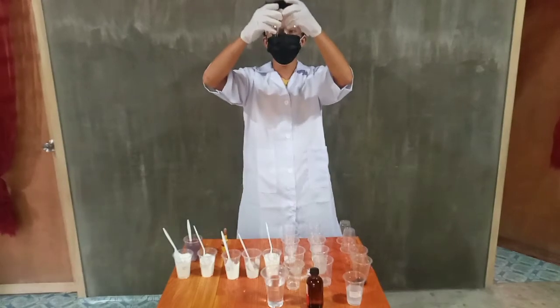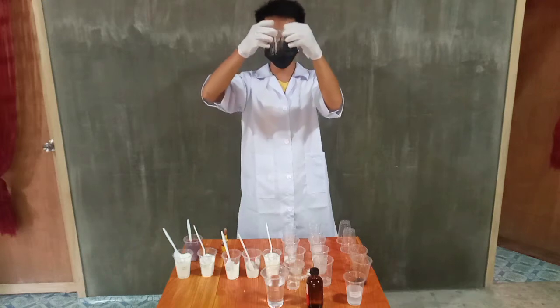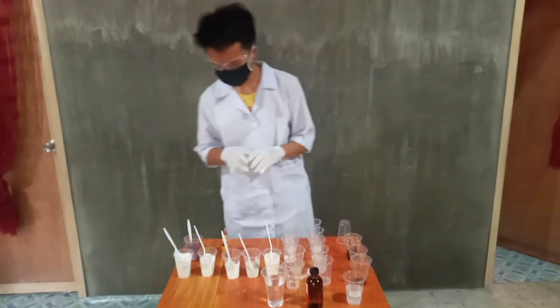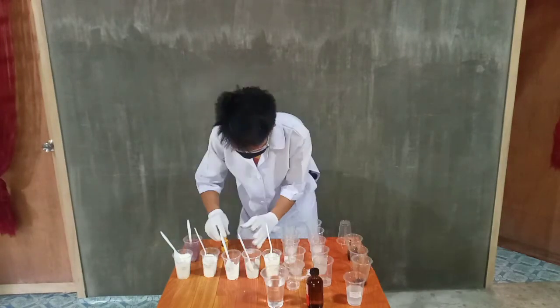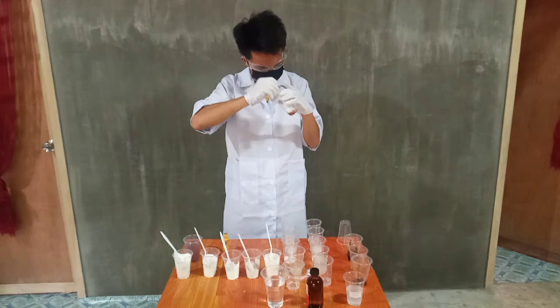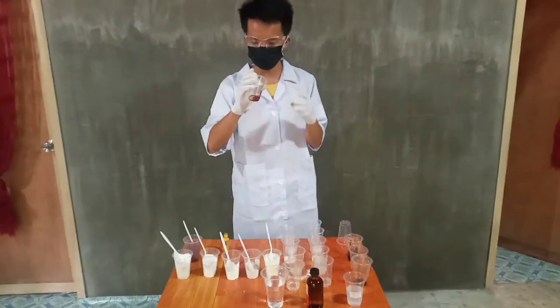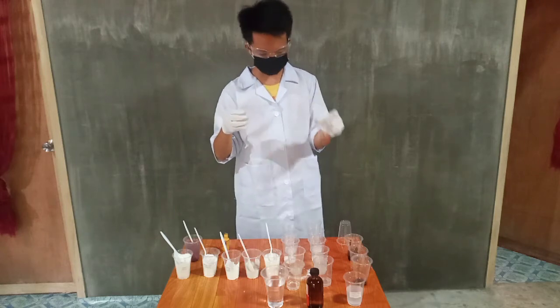The next one is the cornstarch and the iodine. In this mixture, it will form a black color, the mixture of cornstarch and iodine. The next mixture is the baking soda and the iodine. In this mixture, the color will become red, and the baking soda will become melted when you mix it with iodine.